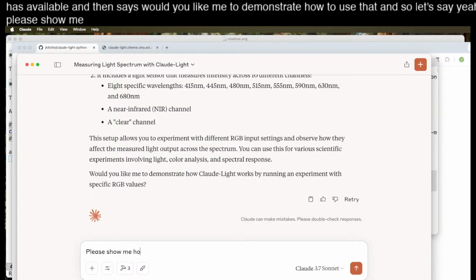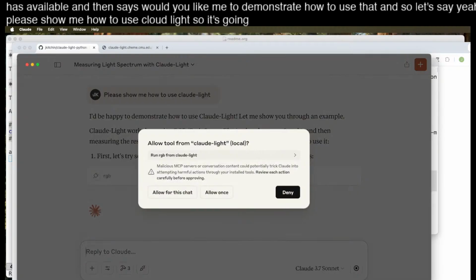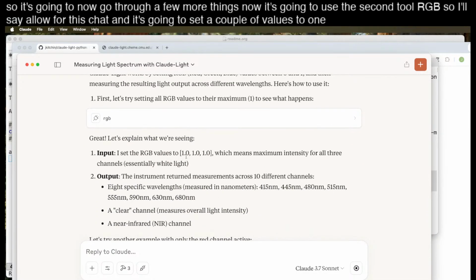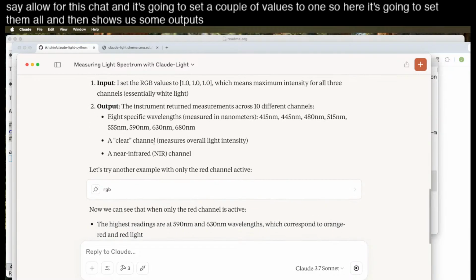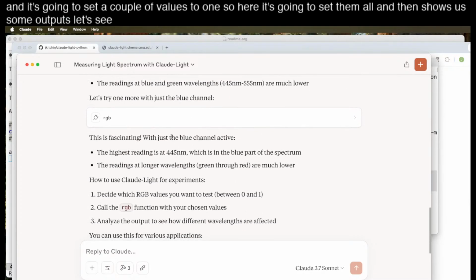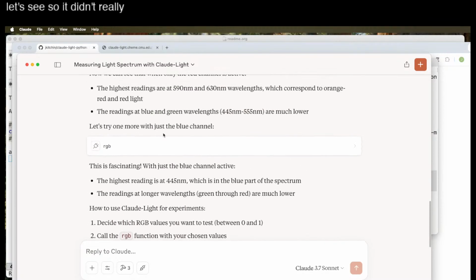Please show me how to use Claude-Light. So it's going to now go through a few more things. Now it's going to use the second tool, RGB. So I'll say allow for this chat. And it's going to set a couple of values to 1. So here it's going to set them all, and then shows us some outputs. So it didn't really give us anything super exciting there.